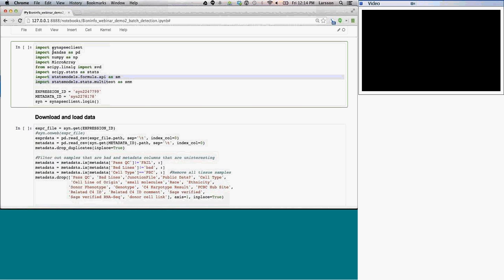for doing modeling, and the Synapse client so that we can fetch the data and upload the results. And then below that, I have defined some constants which describe where the data is located, and I'll show you again what that looks like. And then lastly, I just log into Synapse so that I get access to this.